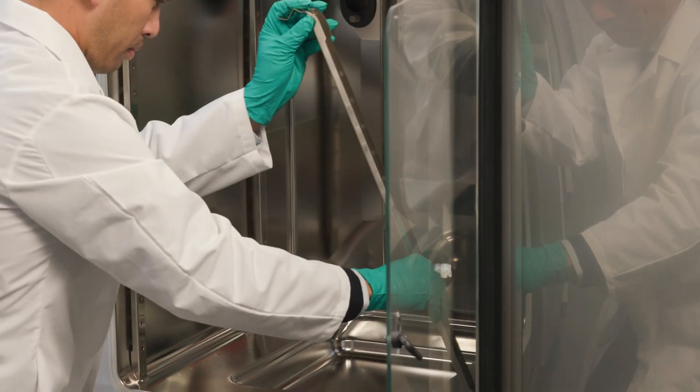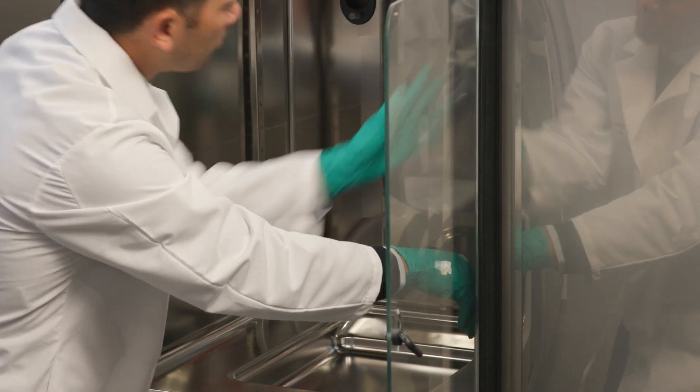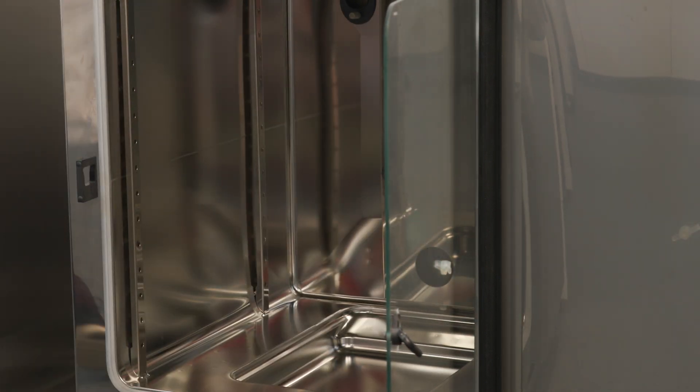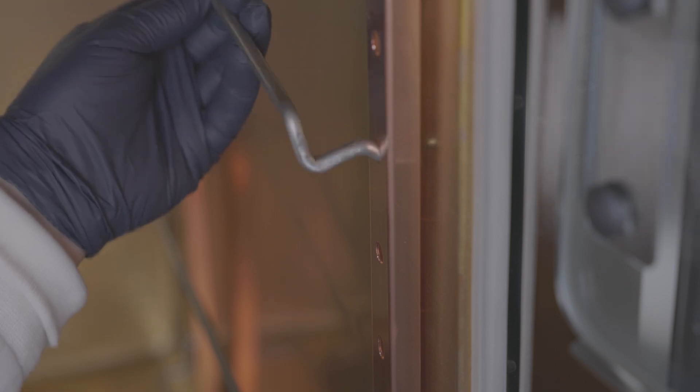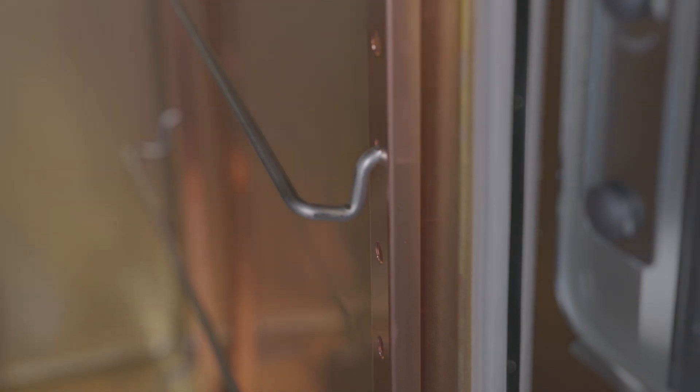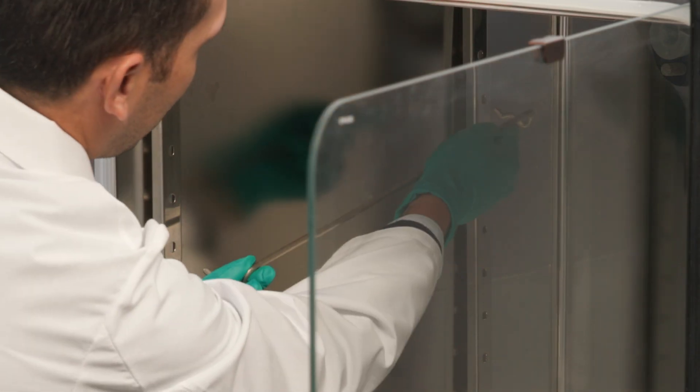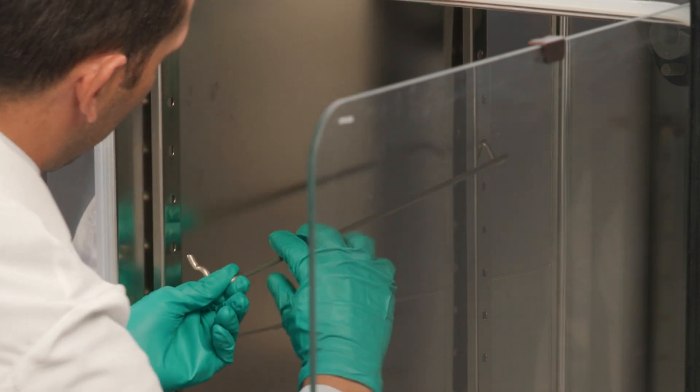To remove the support rails, pull the lock spring tab out of the embossing and remove the rail. Start by inserting the shelf supports into the perforations of the support rail with the bar facing down. Then, make sure that the two vertical elements of the shelf support are flush with the support rail.